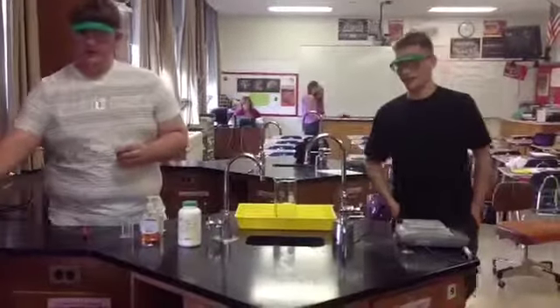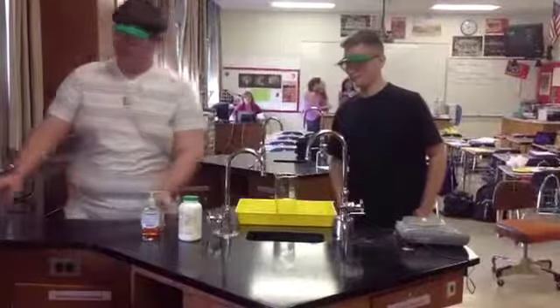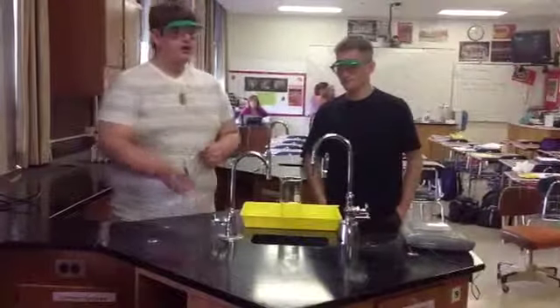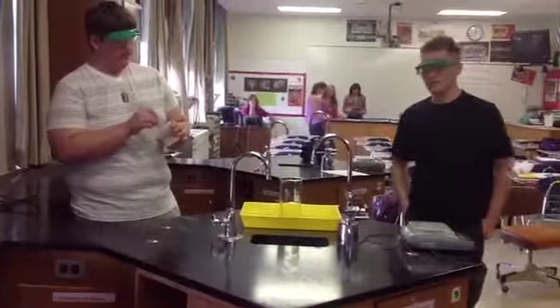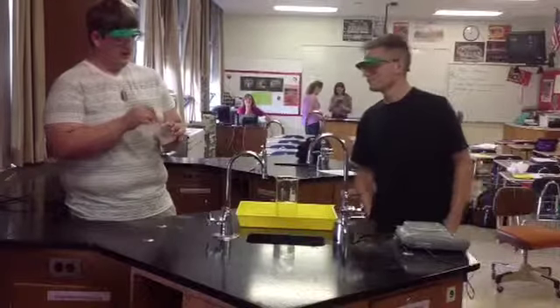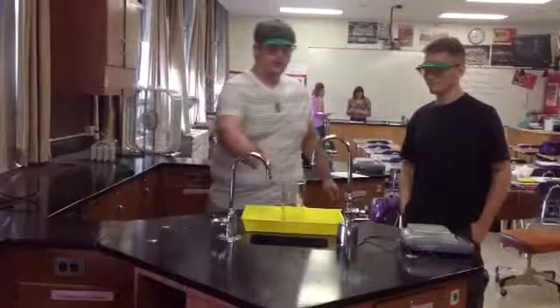We're going to want to move all of your chemicals to the side so that they don't get splashed by the resulting foam. Chemical mixing, when you're not in control of it, is always a bad idea. It should be noted, this is an exothermic reaction that produces quite a bit of heat. Give this a whirl here. Add it to the container and stand back.